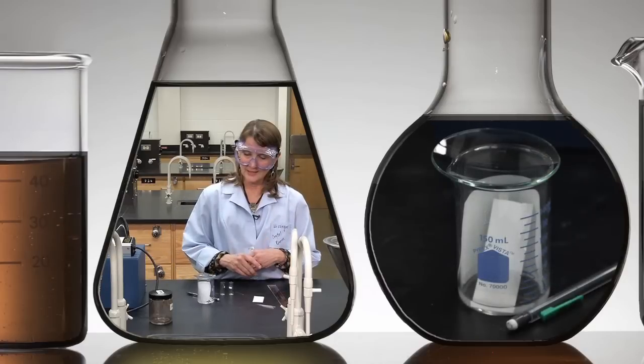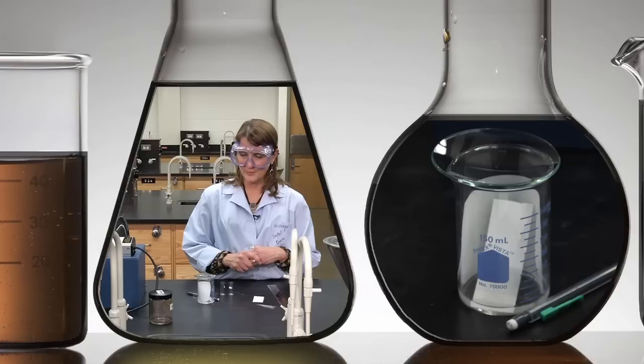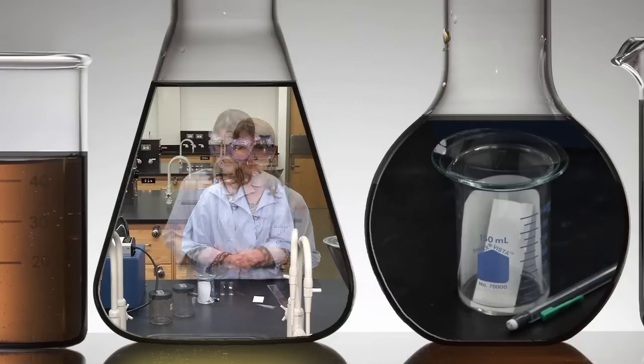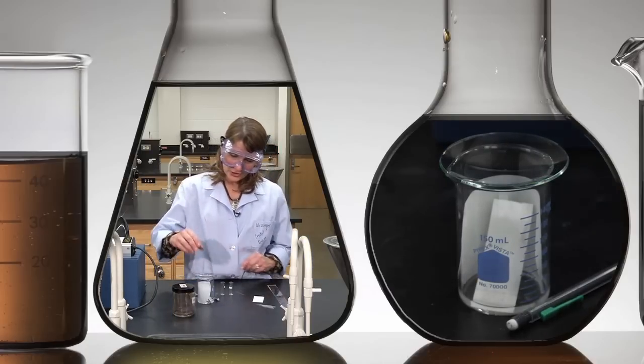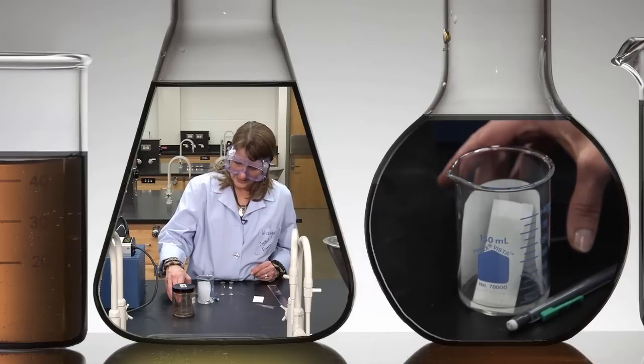You want to let the TLC run until it's about a centimeter from the top of the plate. The solvent's reached a good height on the TLC plate, so I'm going to gently remove it.